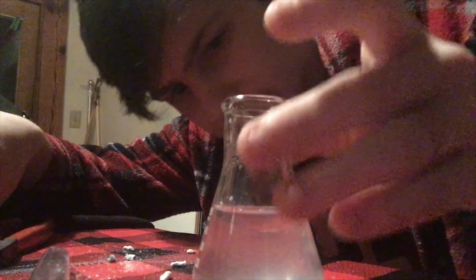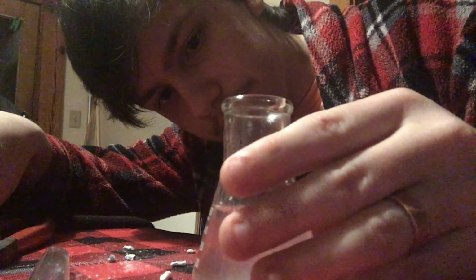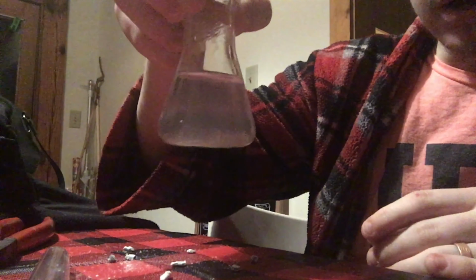That chalky substance right there is calcium hydroxide. It's a little cloudy now. I have to hold it like this now. So yeah, it's a lot cloudier. So let's add in another little piece. Oh wow. It's producing hydrogen.